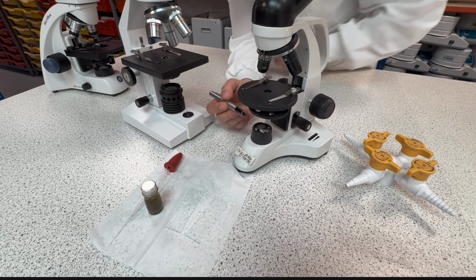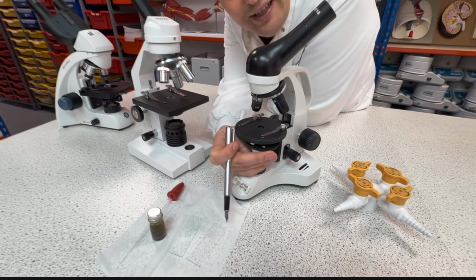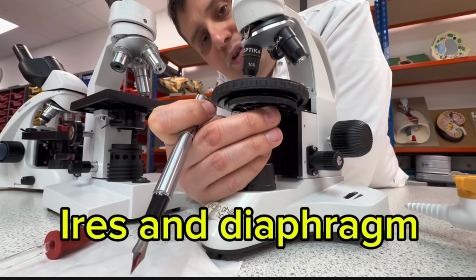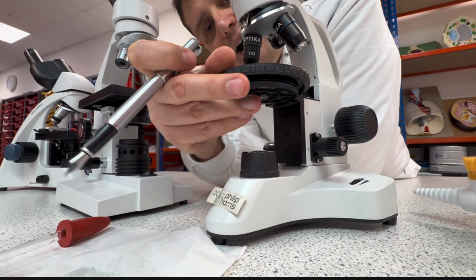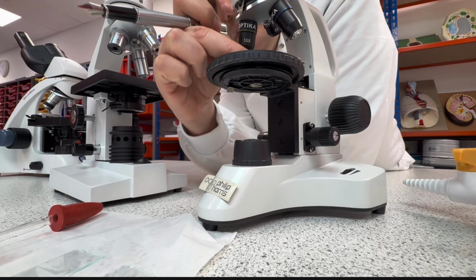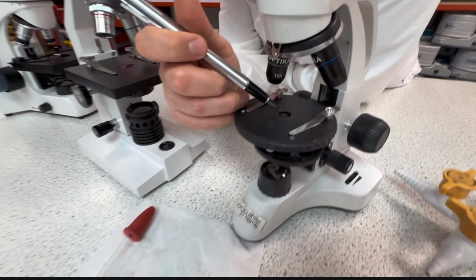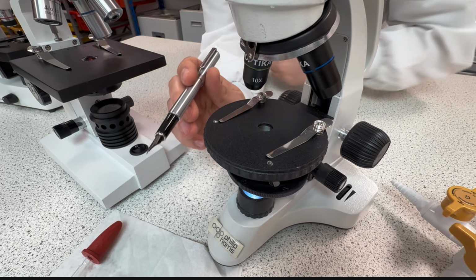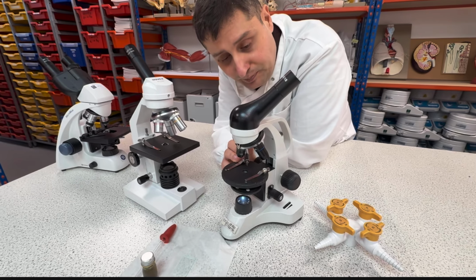Under the stage, I have this part here. This is called the iris or diaphragm. This works to control how much light is passing through the stage. The stage has a hole in the middle where the light comes through. If I turn it on, you can see the light passing through the stage.